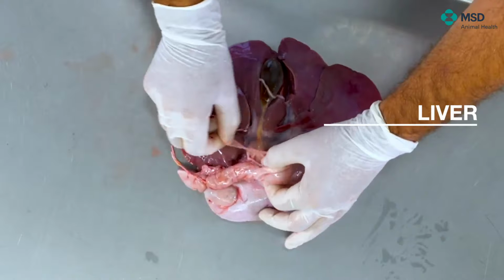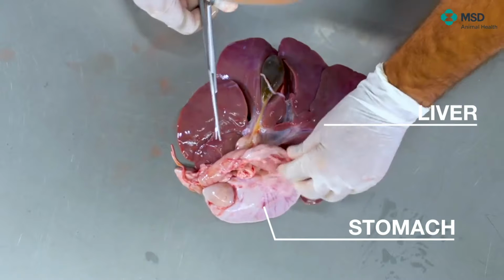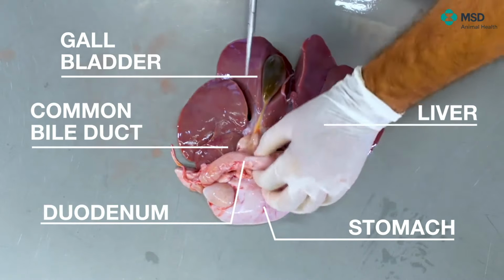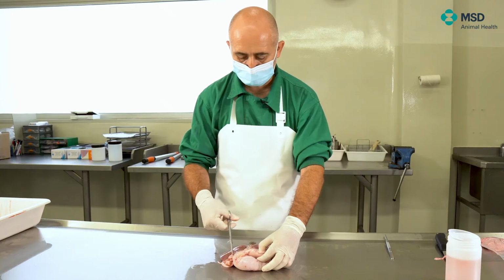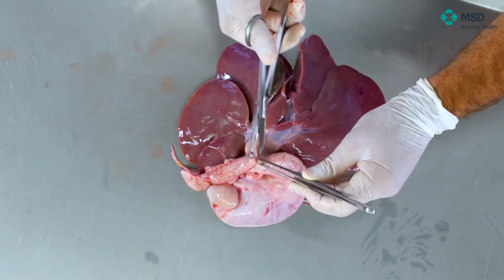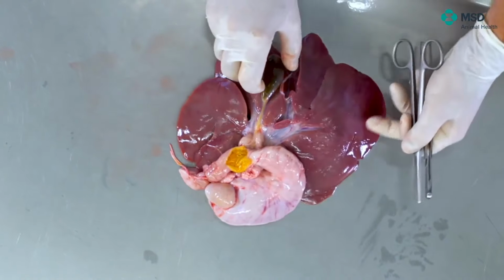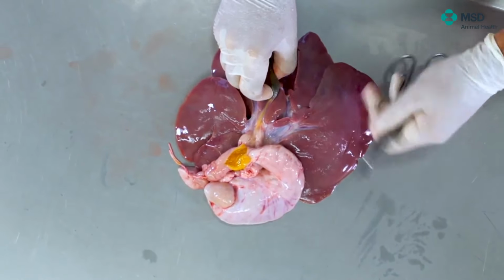So what we will do now, as you will see, is remove a little bit of omentum in order to see it much better. But what we will see here is the gallbladder, which looks normal, and theoretically is going to the duodenum, so at that point, it looks perfect. And what we will do now is just a small cut of 2-3 centimeters in length in order to be sure that we are in the duodenum. And then we will press the bile or the gallbladder in order to be sure that the material is getting out.